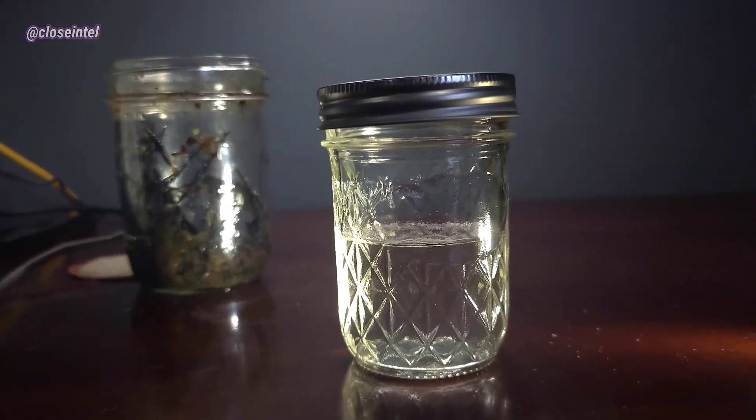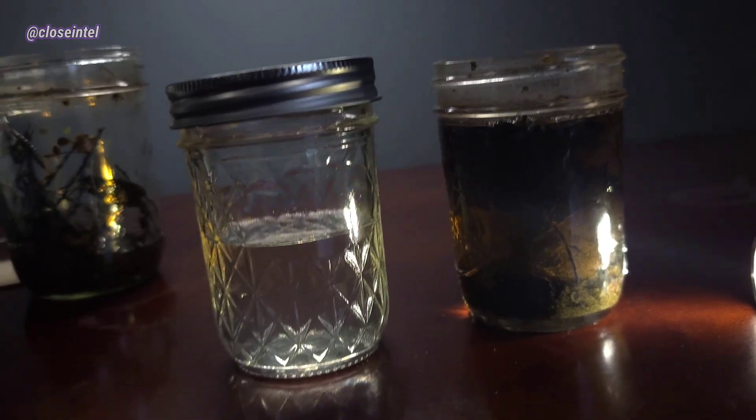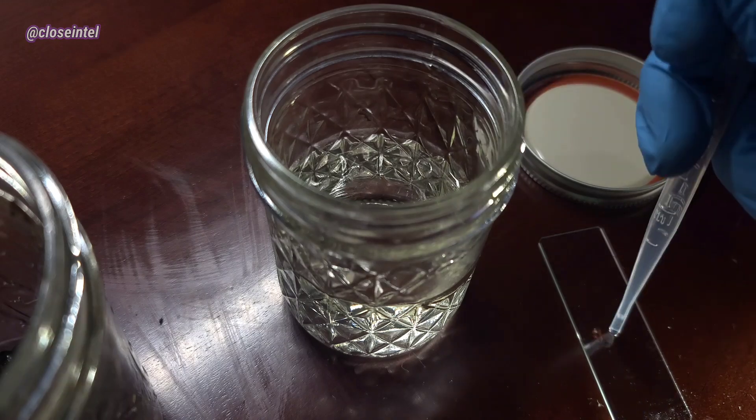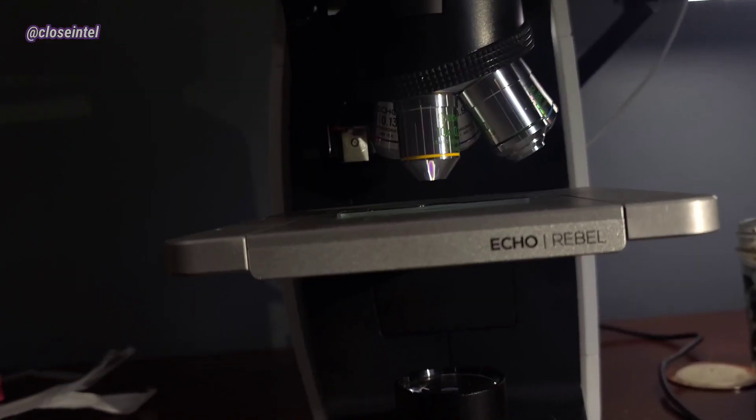As you can see there's a big noticeable difference after being filtered. I was expecting a yellow tint to this but it's actually pretty clear too. Now we can grab a few samples of the filtered water to see how well it was cleaned.